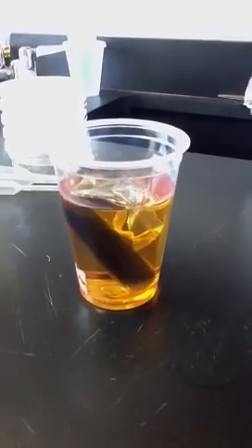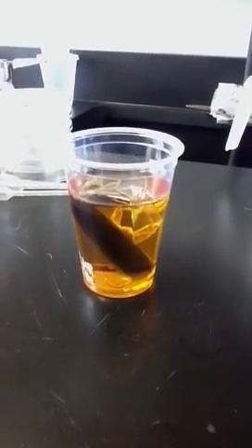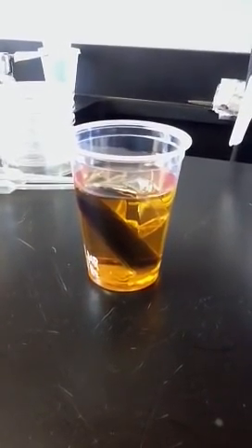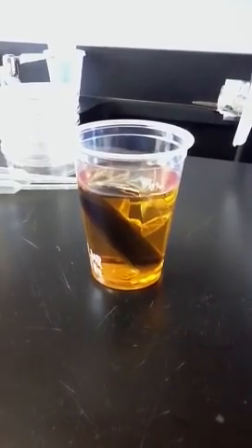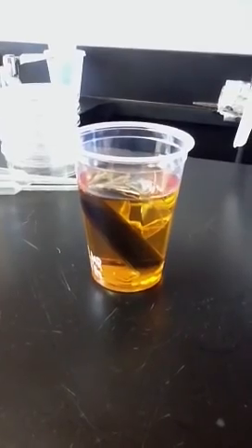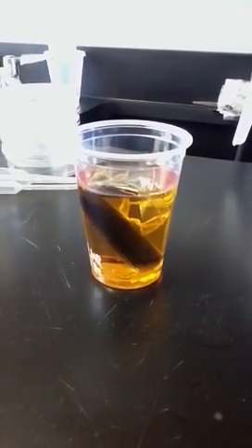What you are looking at here is the after picture. In the cup, in the solution, is iodine, so the solution is an orange-y color. In the bag, in the dialysis tubing, we put glucose and starch.